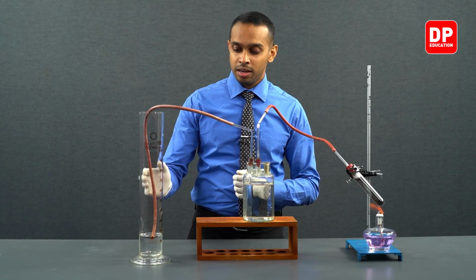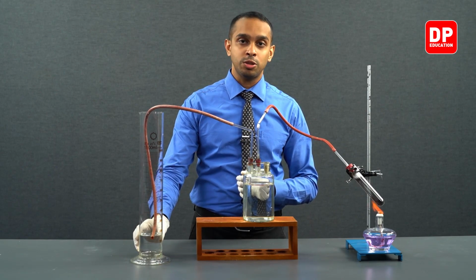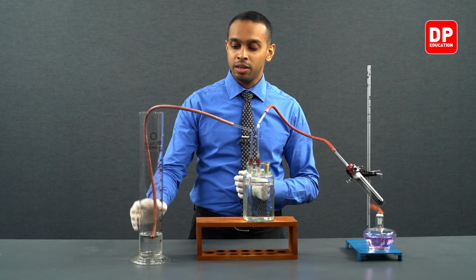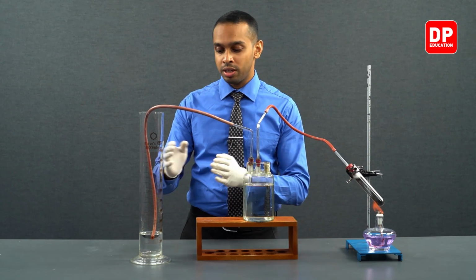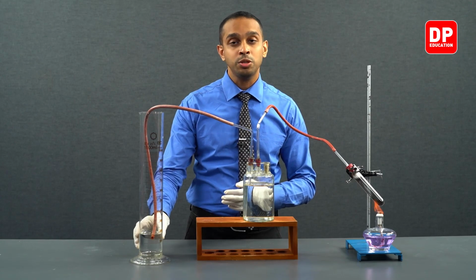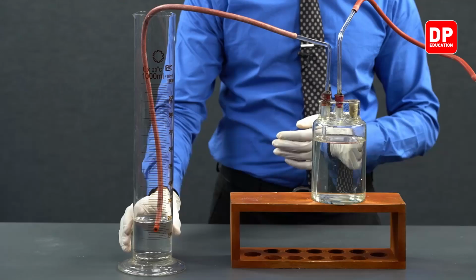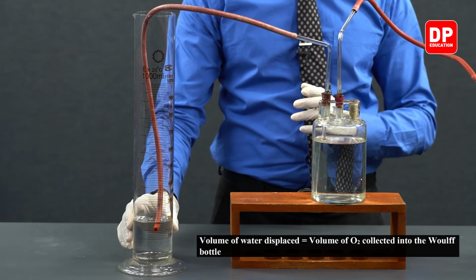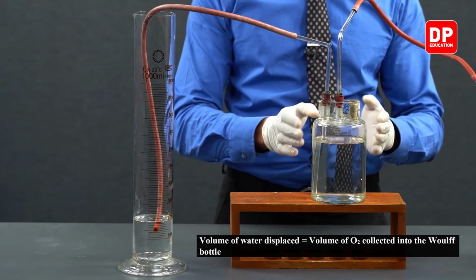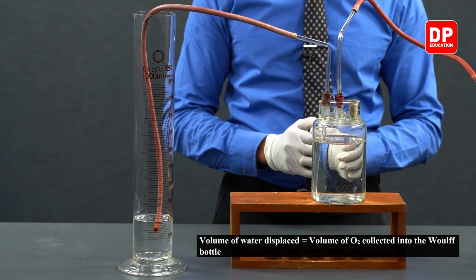And the volume of oxygen that is produced can be obtained with the help of this measuring cylinder. You can see that water is being displaced into this measuring cylinder, and the volume of displaced water is equivalent to the volume of oxygen gas that is collected here.